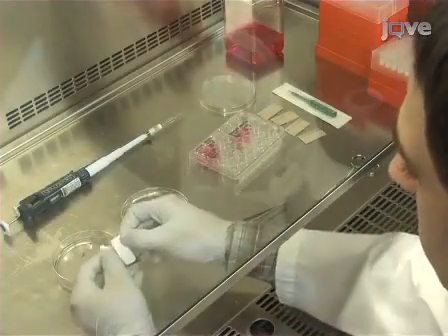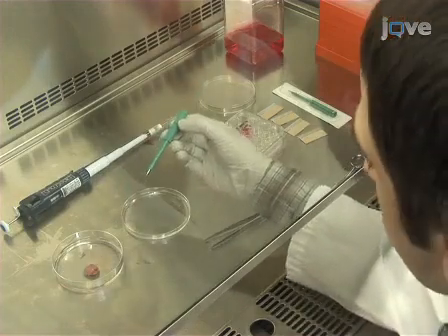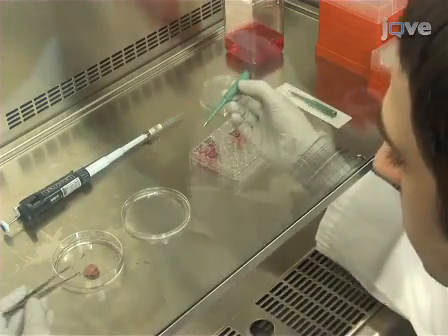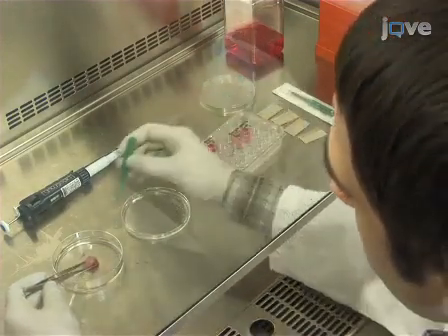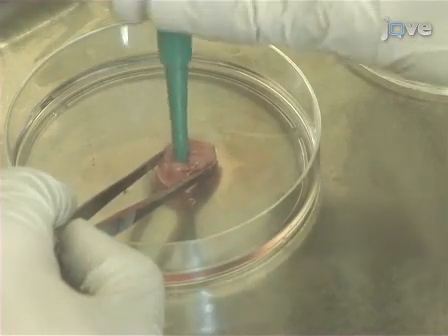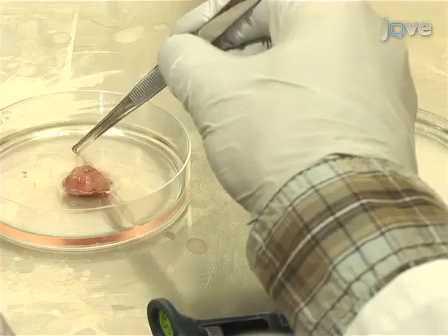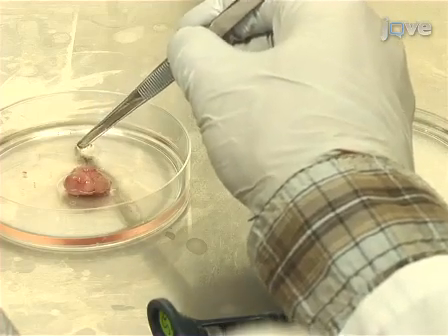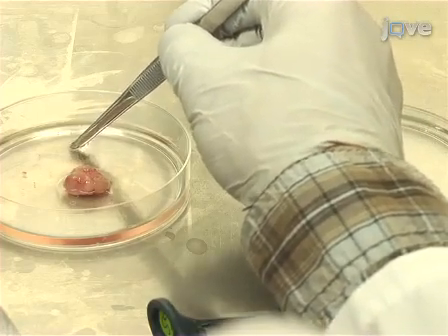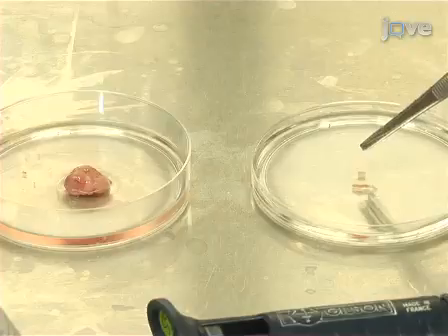Working in the laminar flow cell culture hood, use a 2 mm biopsy punch to obtain cores of tissue from various regions of the tissue sample. Deposit each core in the lid of an upturned petri dish containing PBS with the help of a pipette, using forceps to adjust the sample if required. Leave enough space between each core so that they can easily be cut along the horizontal axis.